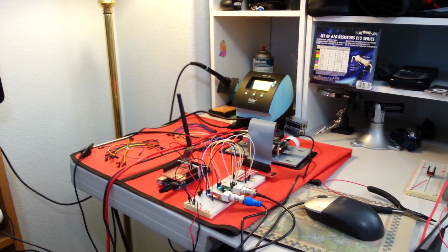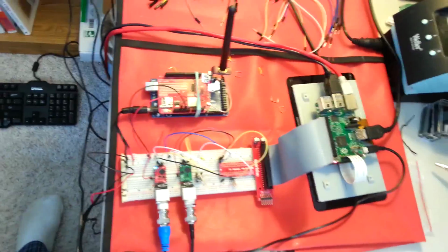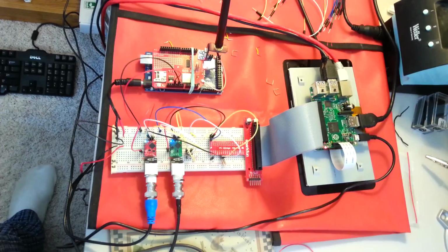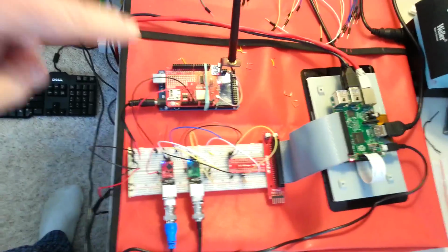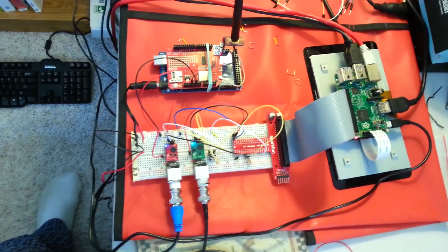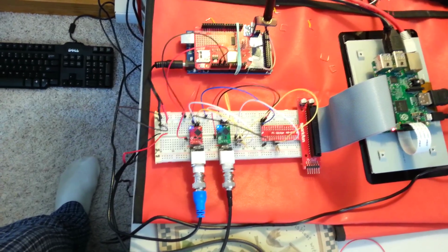Alright, so I now have the Atlas Scientific pH and EC probes working on the Raspberry Pi. The probes pull too much power for the Pi 3.3 volt supply. I think they probably do for the 5 volt also. But I'm using I2C protocol, so I wanted to use the 3.3 volt. So I'm actually employing the Arduino to supply 3.3 volt for one of the probes. And then I'm pulling 3.3 volts, of course, off the Pi on the other side.